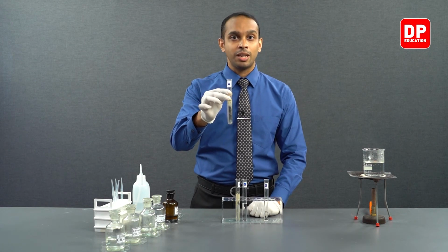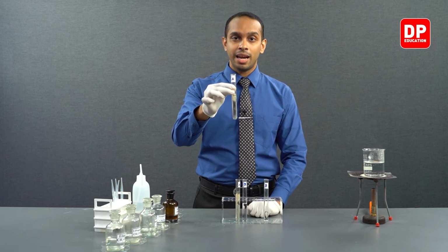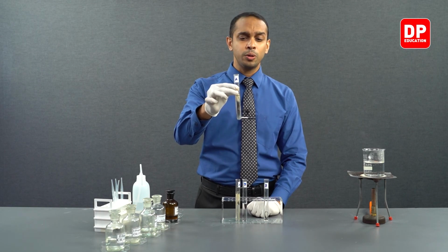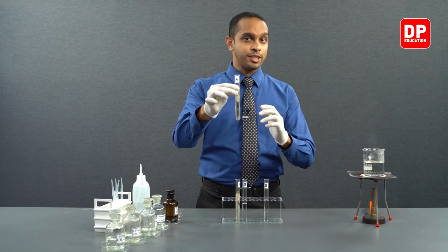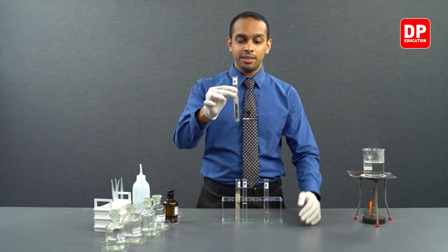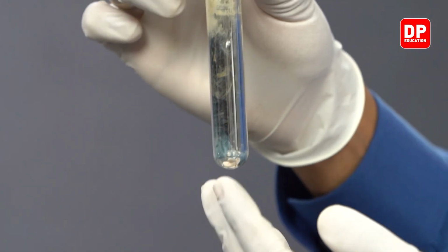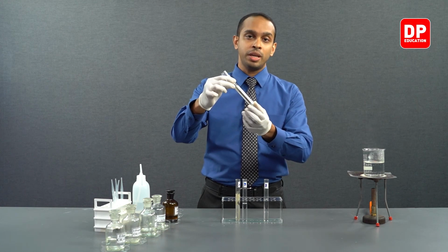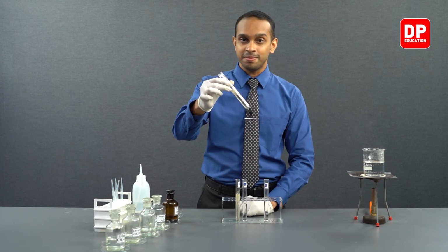While this reduction is taking place, the aldehyde that was present inside this mixture gets converted into a carboxylic acid. So, the aromatic aldehyde we had, which is benzaldehyde, gets converted into benzoic acid, and Ag+ ions got converted into solid silver, and this solid silver got deposited onto the interior walls of this test tube, creating a silver mirror.